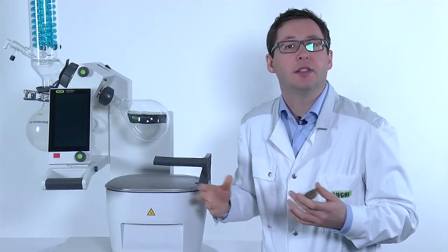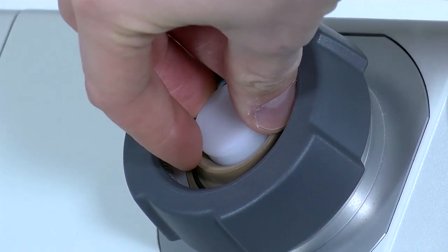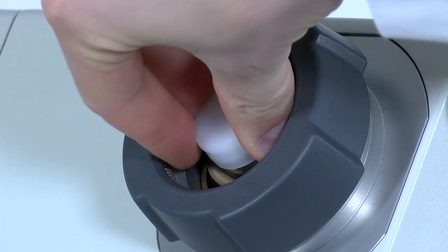The second step is to place the seal onto the correct position and apply pressure until the seal slides off the adapter.